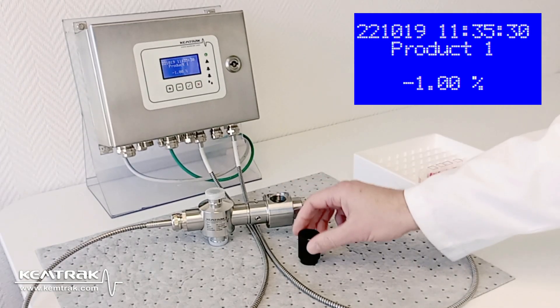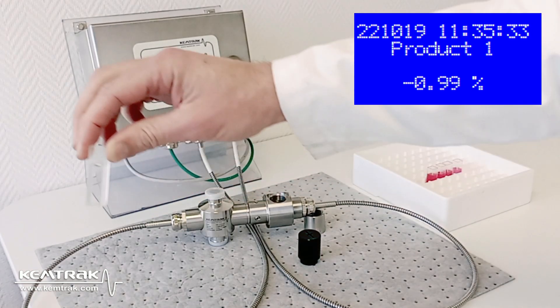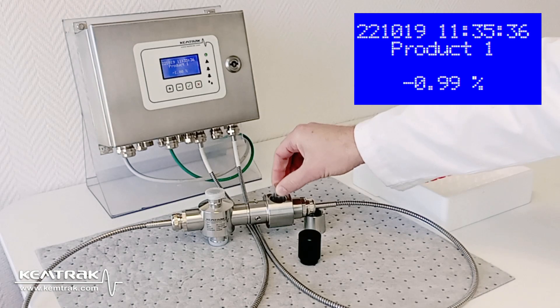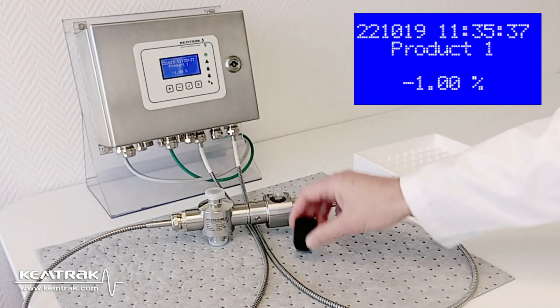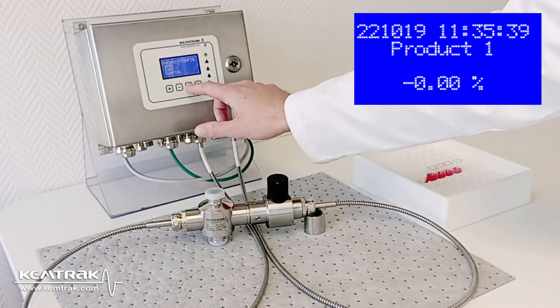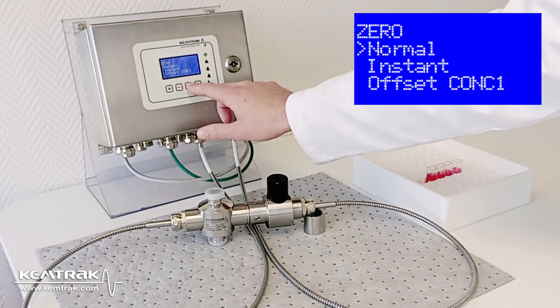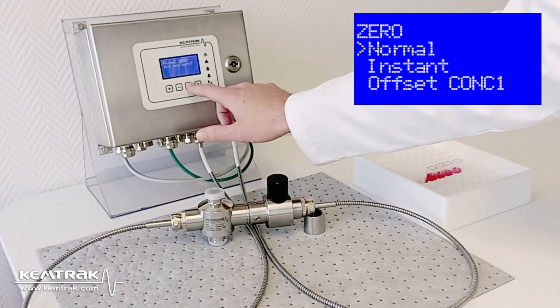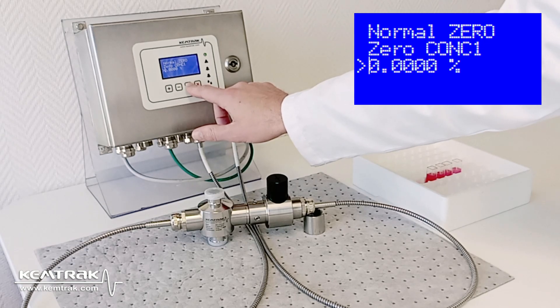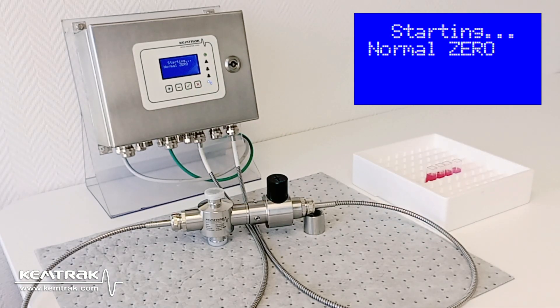Firstly, I zero the instrument using a cuvette filled with distilled water. I ensure the measurement cell is clean. Then, within the zero menu, I choose normal, set the value to zero percent, and confirm.